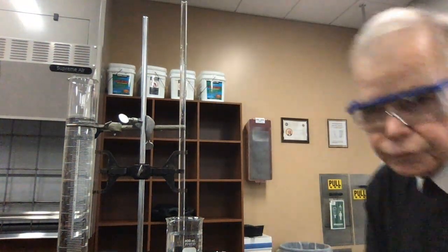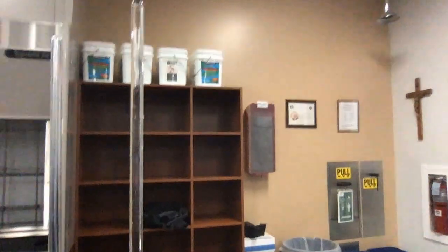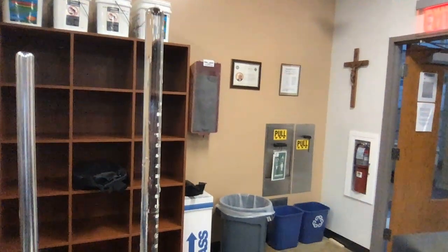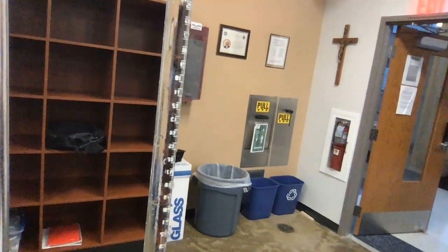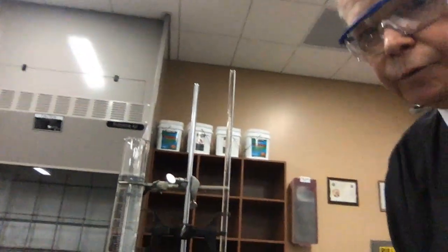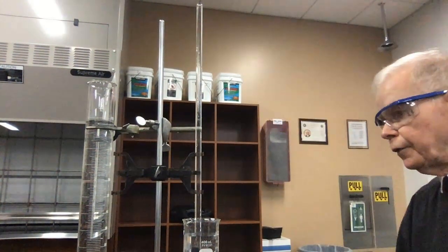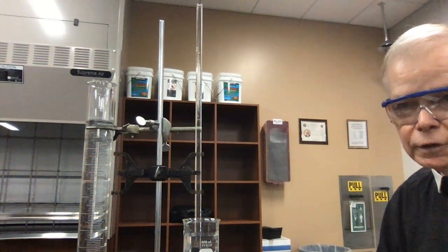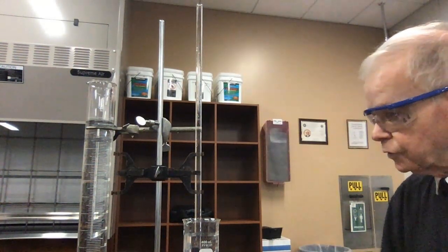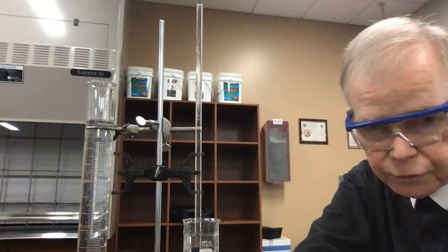I'll leave it set up off the bottom just a little bit. And what's neat about this reaction is that as the acid starts to flow down the tube, you can kind of see a syrupy effect with the liquid. That's going to be hard for you guys to see, but it's like if you were to pour something in here, it has a little different density, which in fact it does. And then as it floats down or comes down through the tube, it eventually will reach the piece of magnesium. Now I'm going to stop the video here for just a second because I want to wait until we get some action down at the bottom here rather than waste your time.